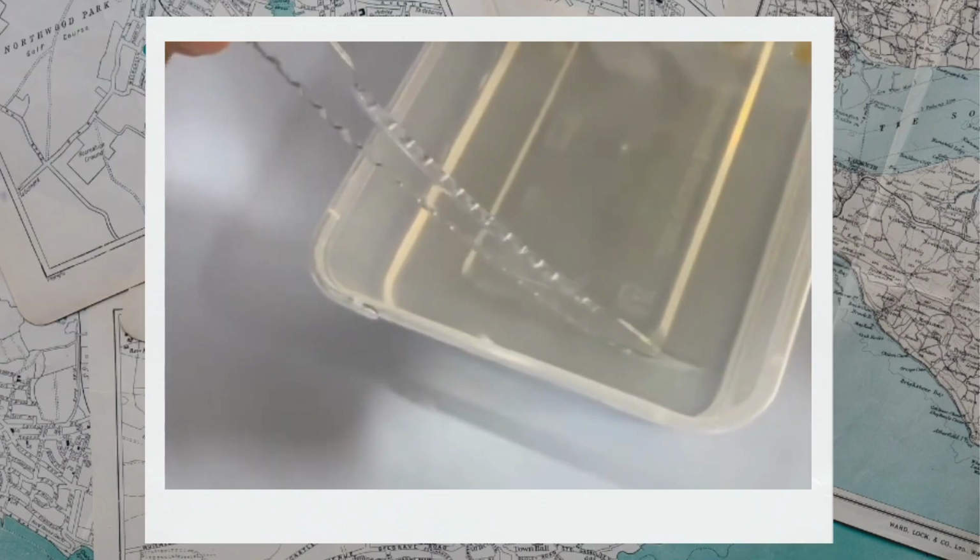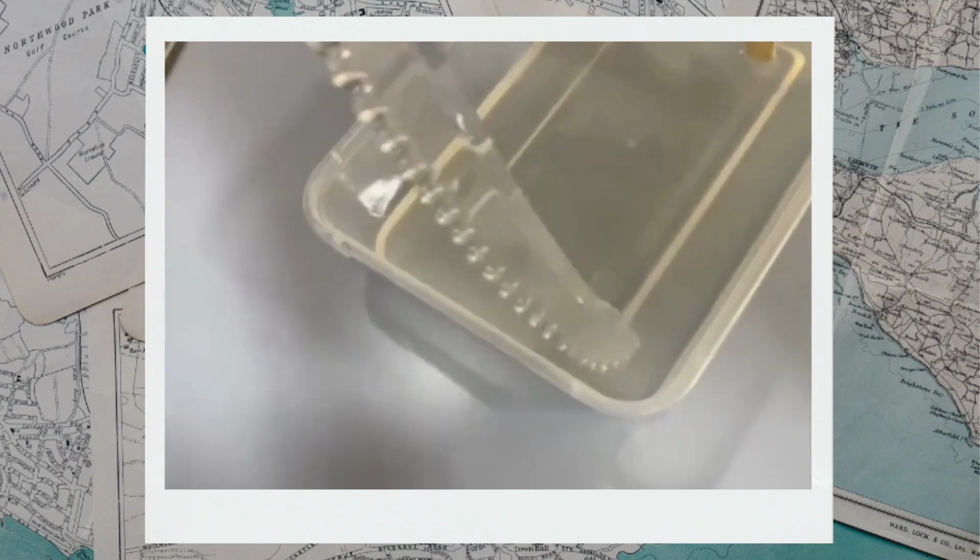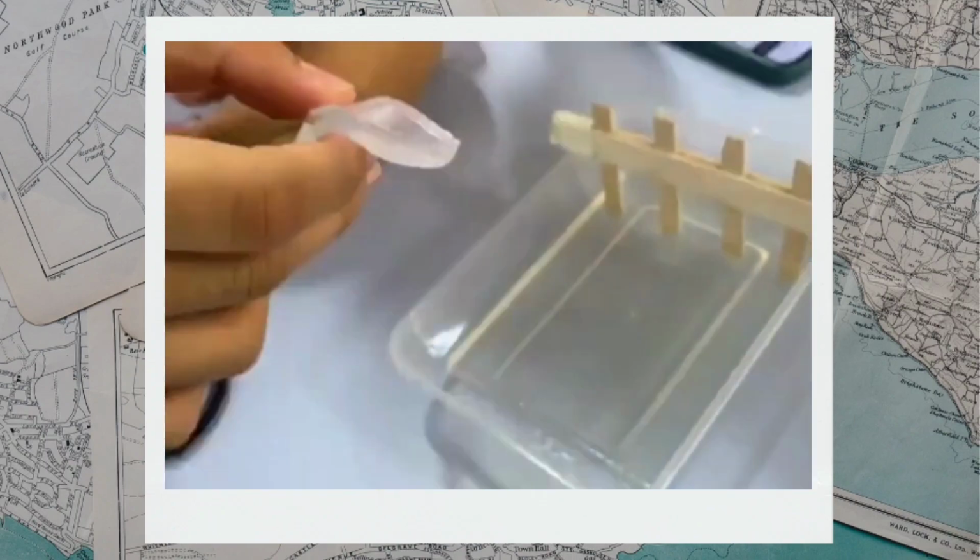Once the gel sets, approximately 5 to 10 minutes, you need to make space to place an electrode on either end.